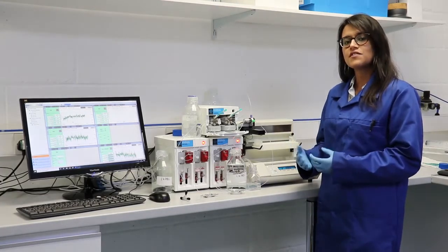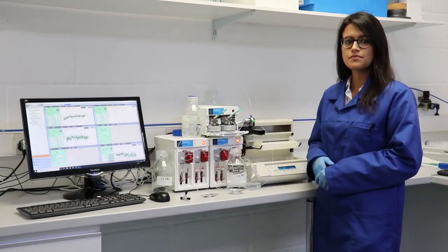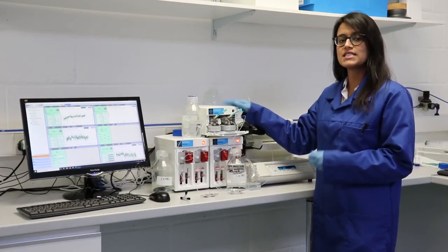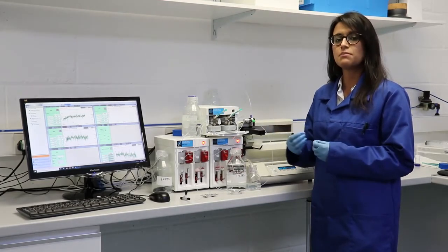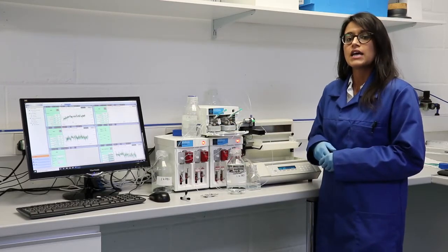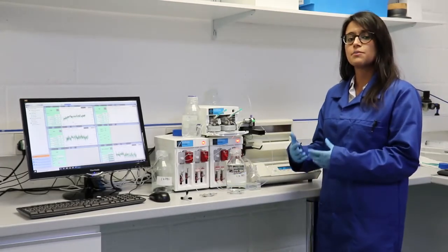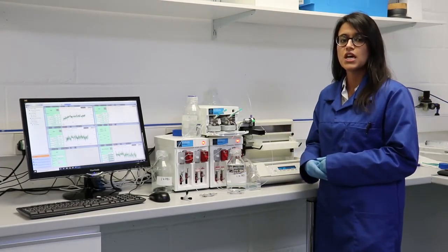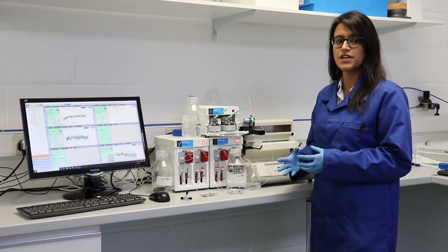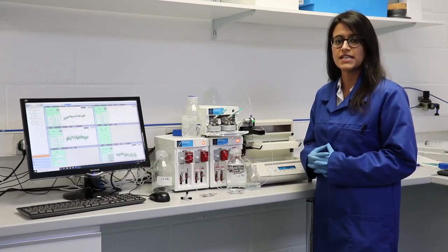You can choose your driving fluid depending on your formulation. In this case, I'm using PBS. During the run, the automated sample valve releases the defined volume of your NP precursor from each loop. So here we've got the sample loops to converge into the droplet chip junction, and you can choose up to 3 different chip geometries to create your lipid nanoparticles, each one having a specific benefit. If you want to find out more, please visit our Dolomite Microfluidics website.